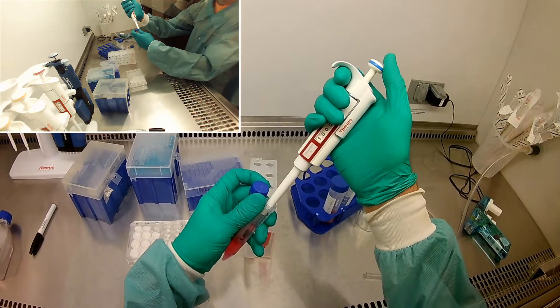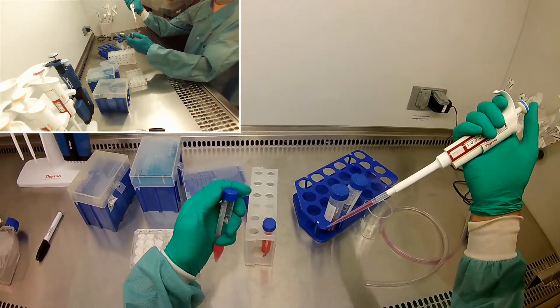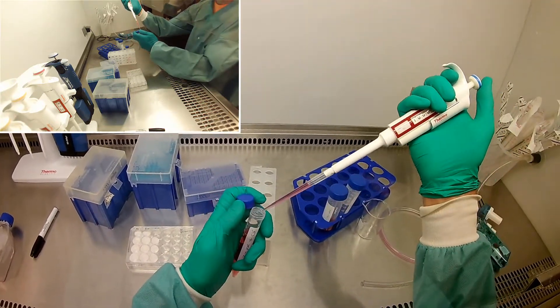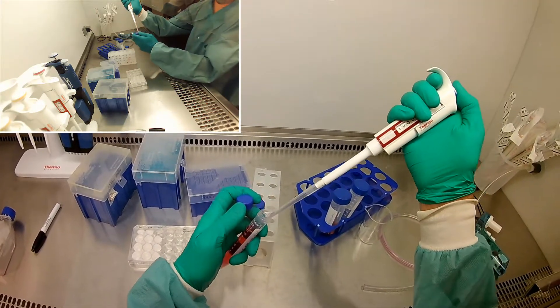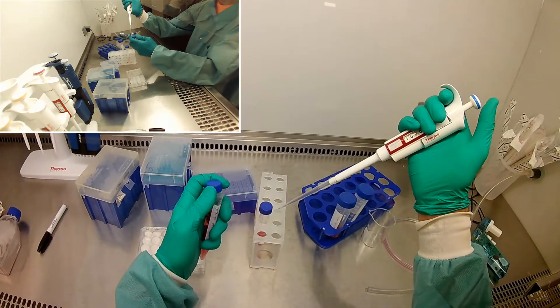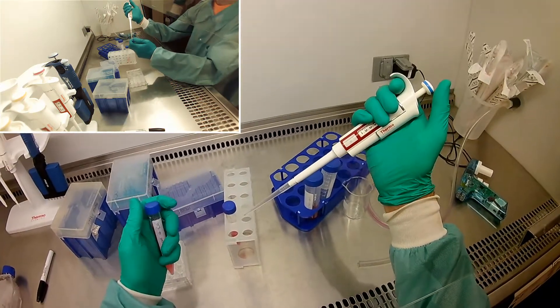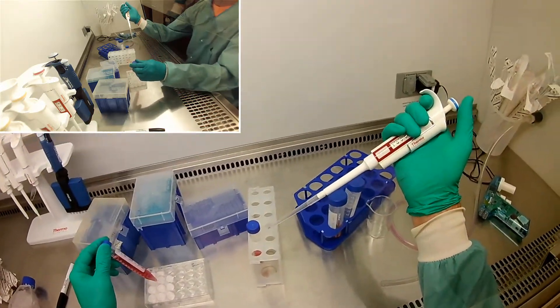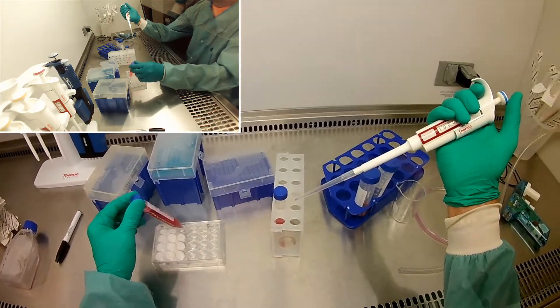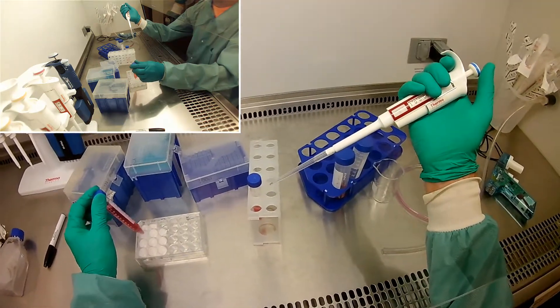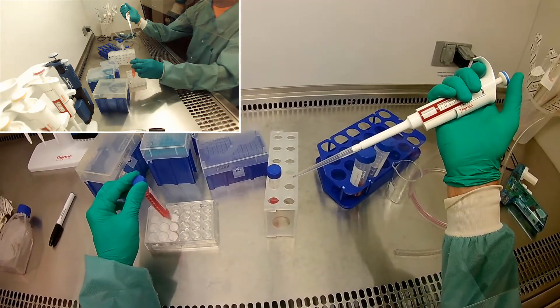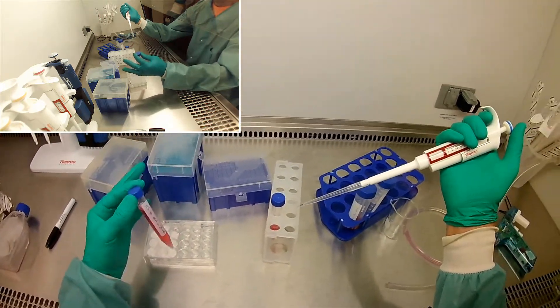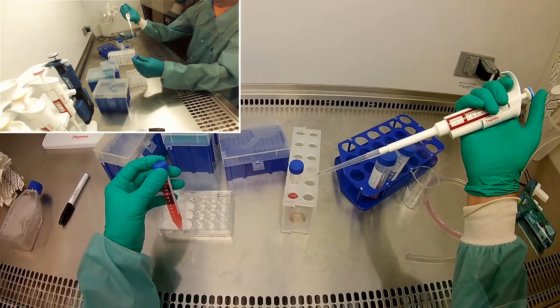Now from here on out, I'm going to be honest, our sterile technique can be a little bit slack because sterility is not that big a deal anymore, right? These cells I just got some out of, we're going to throw those things away anyway. The cells that we're seeding in these wells, we're only going to seed them for an hour and a half, and any contamination will not do much in an hour and a half. It's not really going to affect the cells at all. I mean, maybe if it was really bad, but it's not going to be that big a deal as if we had incubated overnight or something like that.